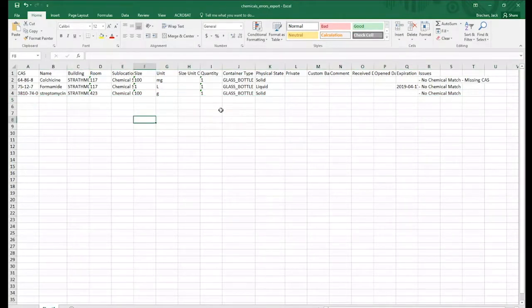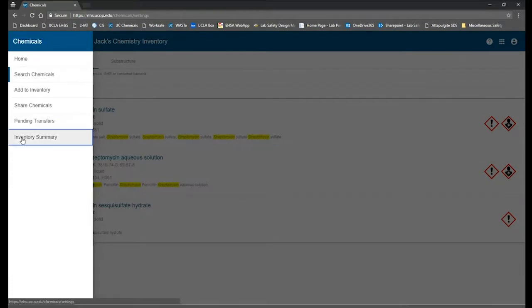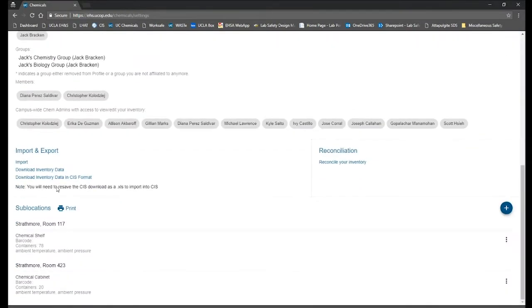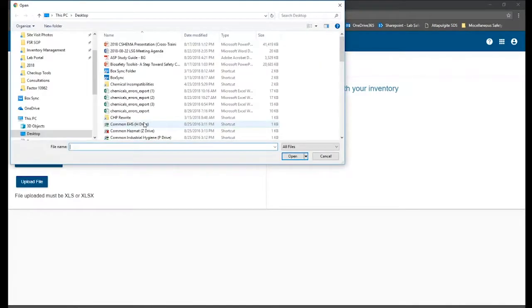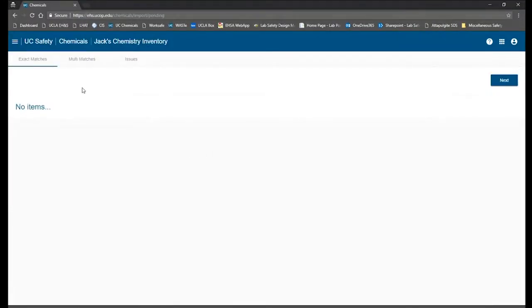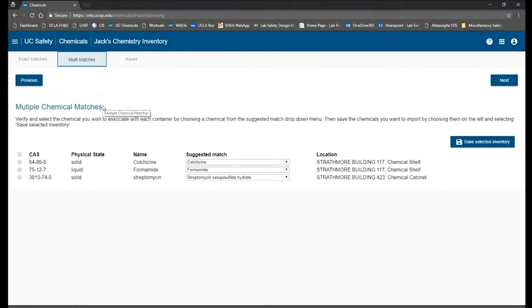I'm going to go ahead and save it, close it, go back into the inventory summary section, scroll back down to import, upload the file that I just saved, chemical errors export, and it looks like I have no exact matches. However, I have 3 multi-matches from the corrections I just made. Those all look fine to me.